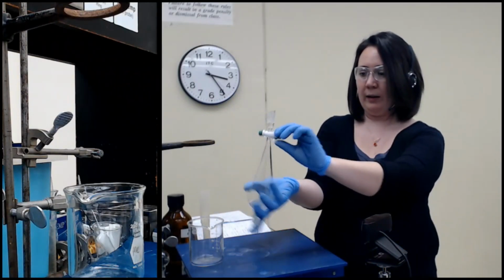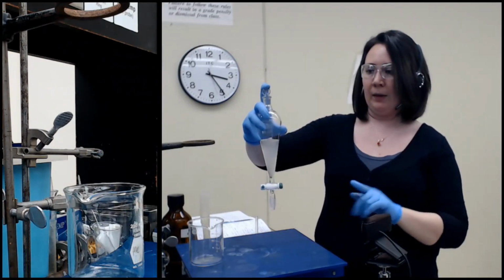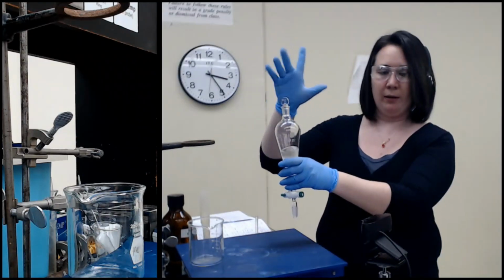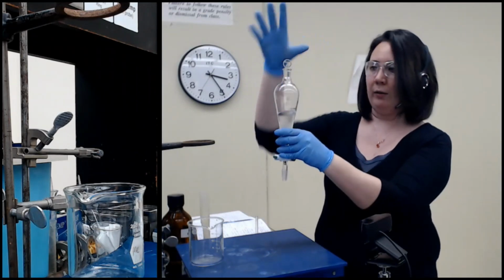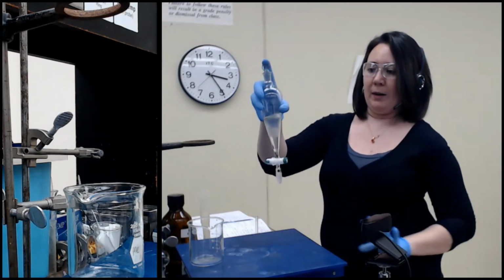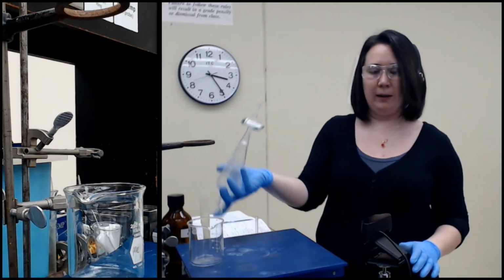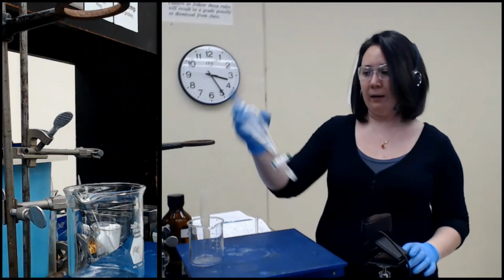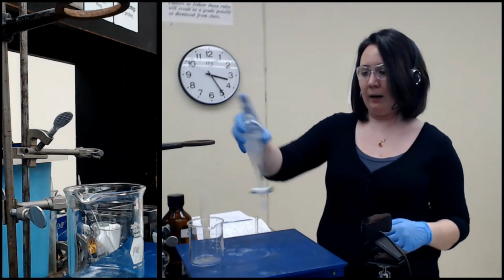Okay, so you can see I am mixing it. I'm holding onto the stopper here. It is easier for me to do it like this with one finger. Some people with larger hands can actually just palm it. I can't even hold on to it that way, so this is much better for me. I like to do it like this, so up and down, not so slow, because that's not actually mixing, but not so fast that we form an emulsion. So just kind of a back and forth.